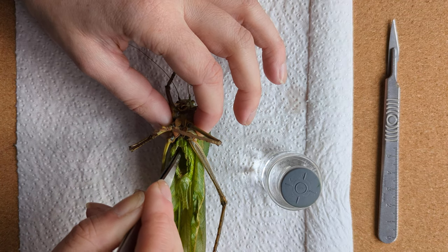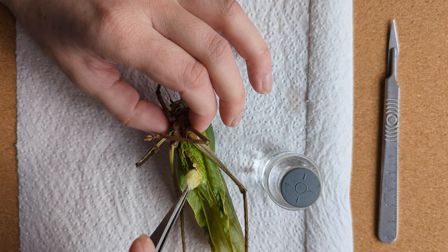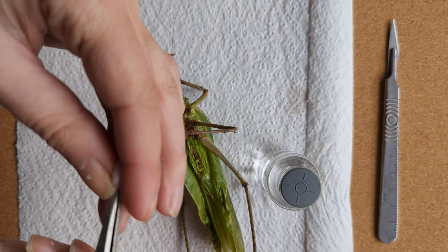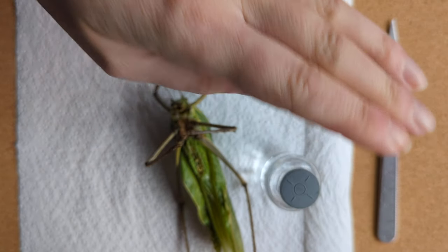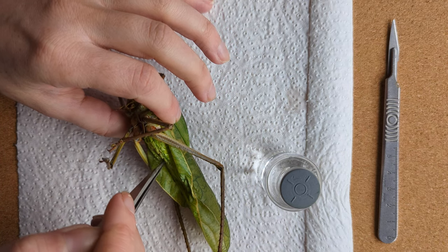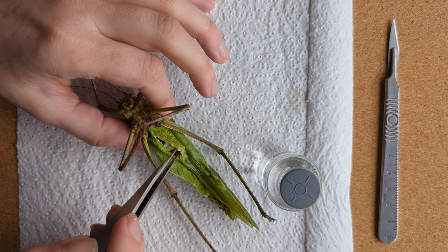This is not terribly dirty — it's not bringing out a lot of rotten brown goo. Tarantulas I've found are the worst ones for it because they're predatory; they seem to have a lot more of a bioactive gut. As with any predatory species, they seem to have a shorter window because they seem to have more bacteria in their gut. Whereas these guys are just eating leaves — there's not a lot to process.